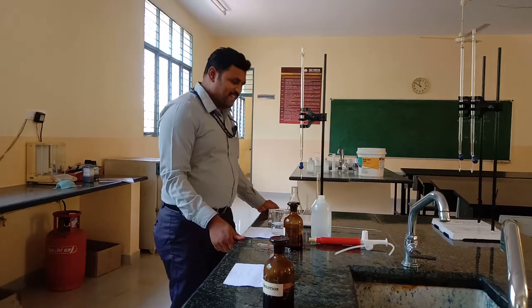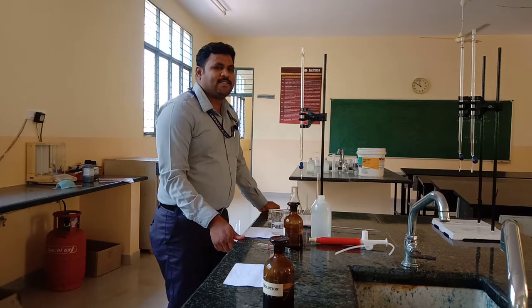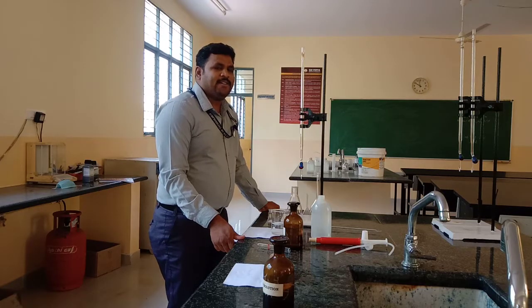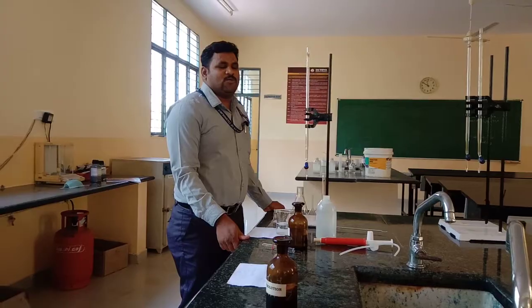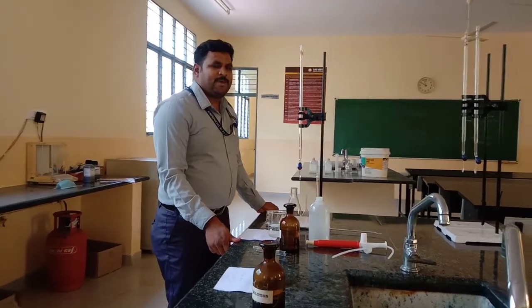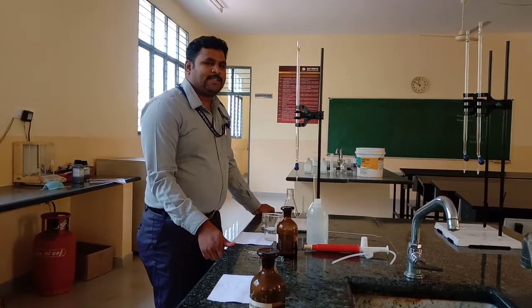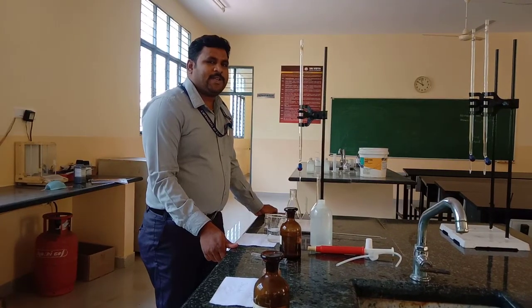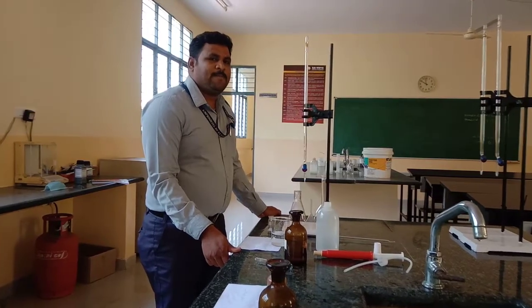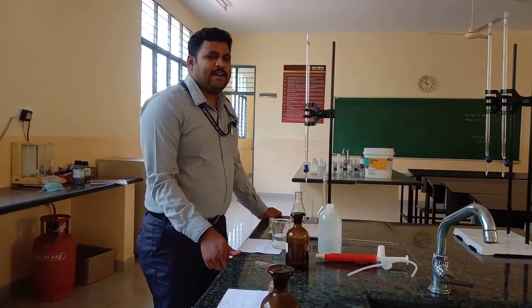Dear students, today we will learn about total hardness of a water sample using standard Na2EDTA solution. This experiment includes two parts: Part A is the preparation of standard Na2EDTA solution, and Part B is the estimation of total hardness of water.